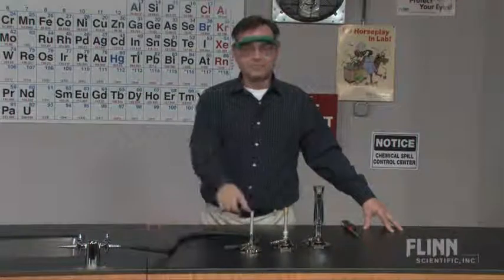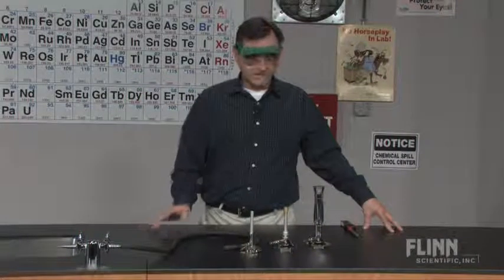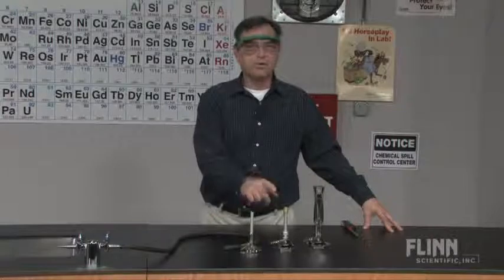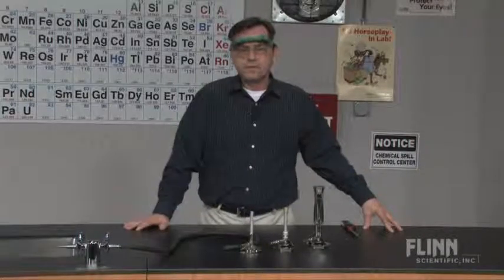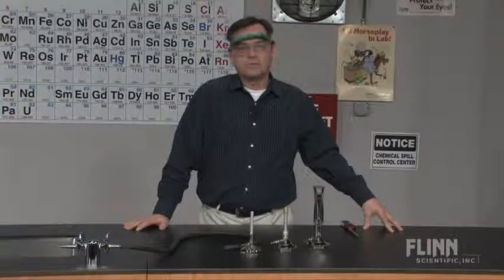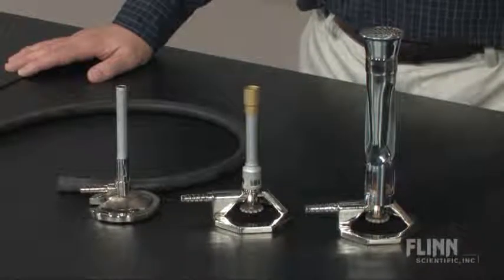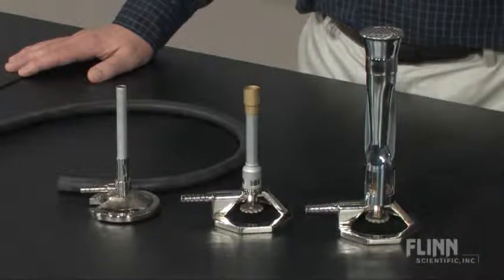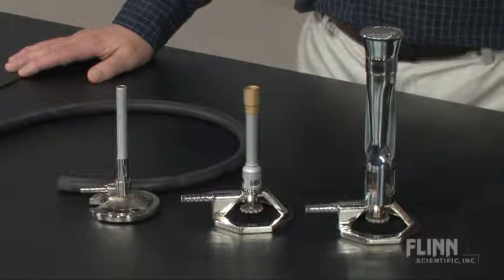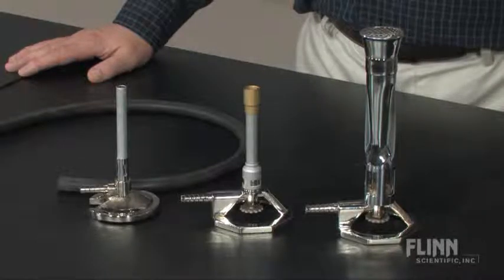Everybody knows what a Bunsen burner is, but what in the world is a Tyrell burner or a Meeker burner? And more importantly, what's the right burner for my lab? These three basic types of lab burners differ primarily in the nature and type of adjustment for gas flow and air intake.